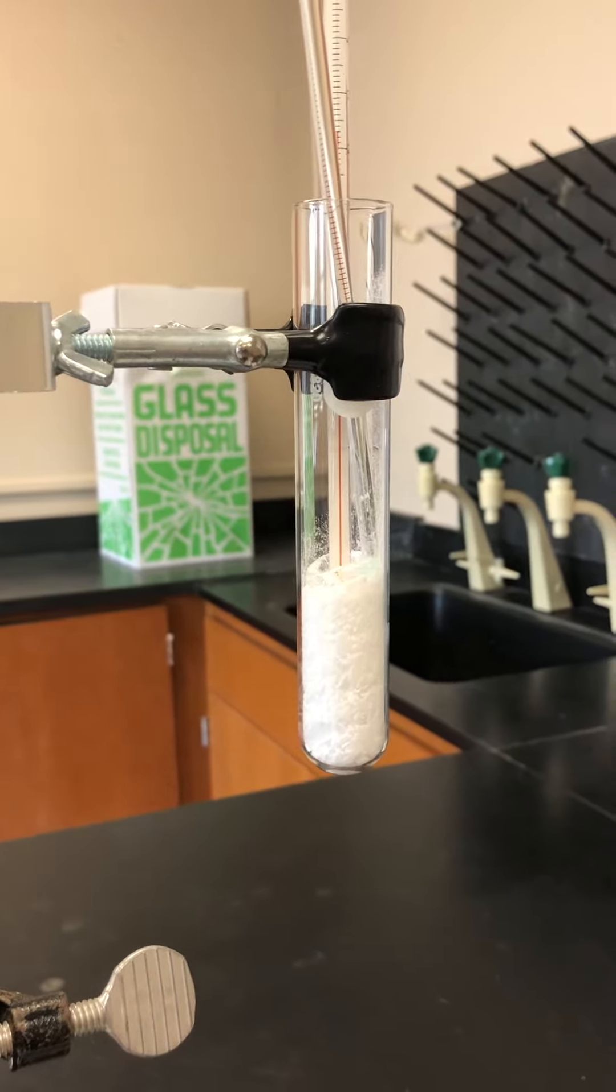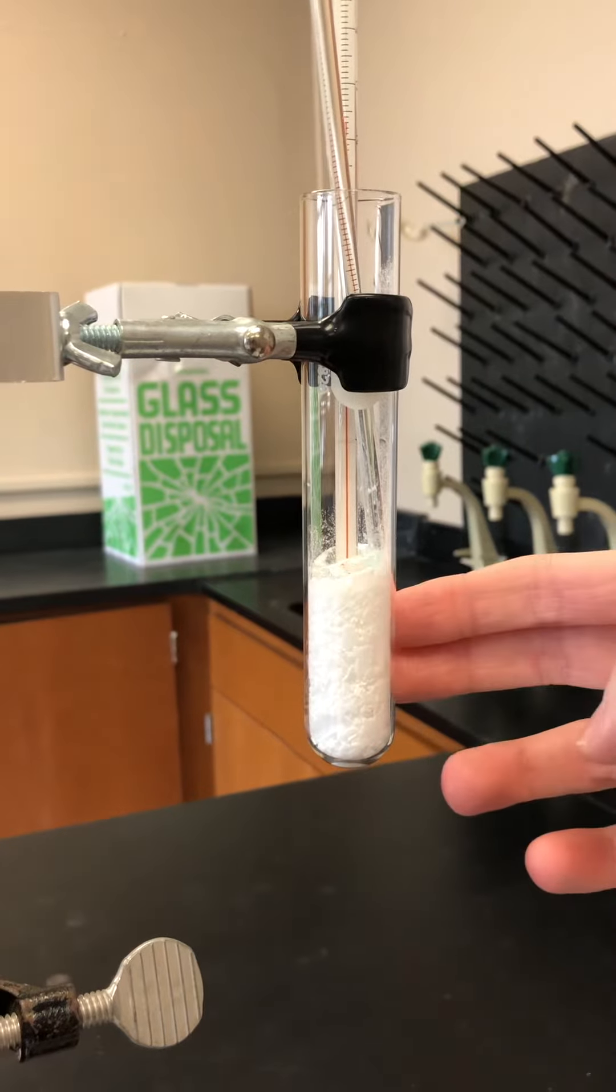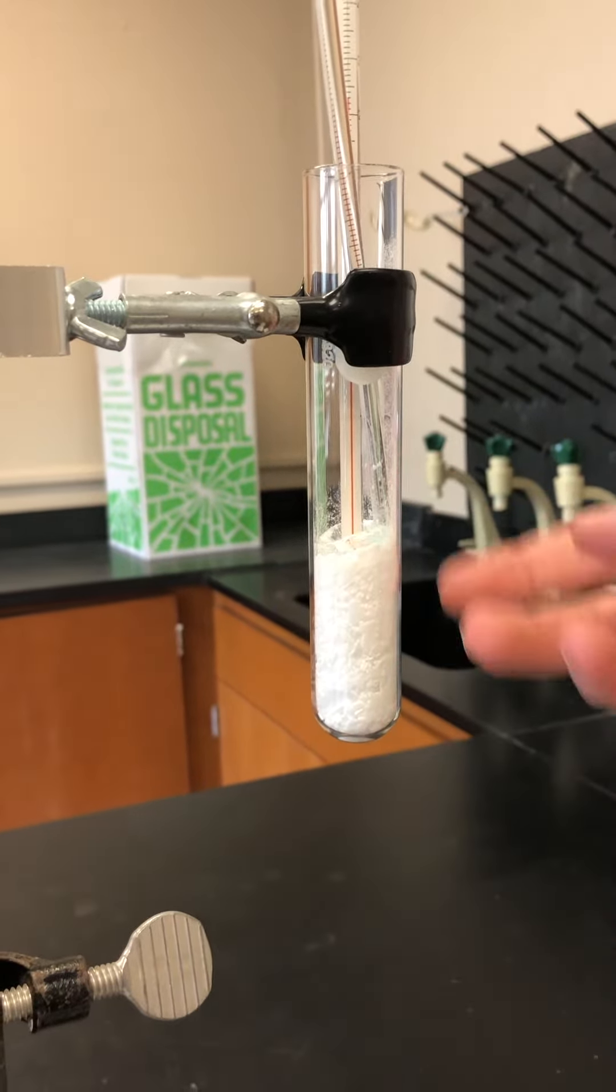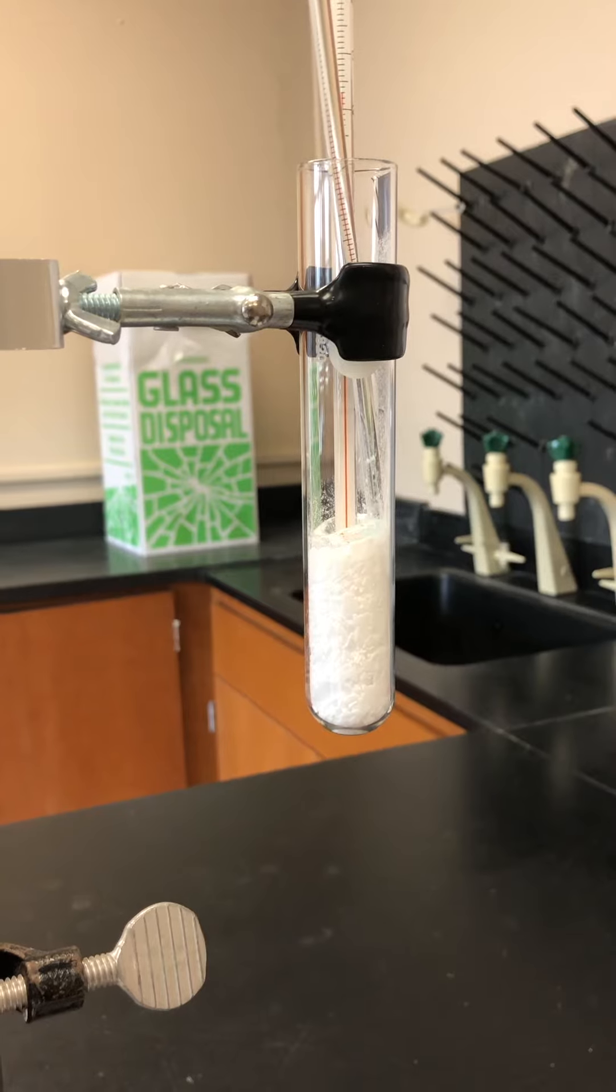So basically what we're going to do is heat up this solid until it melts, and then we're going to cool it down and measure the temperature as it refreezes.